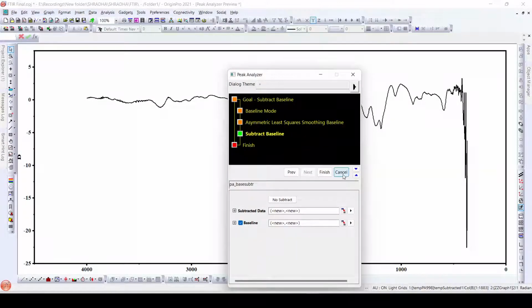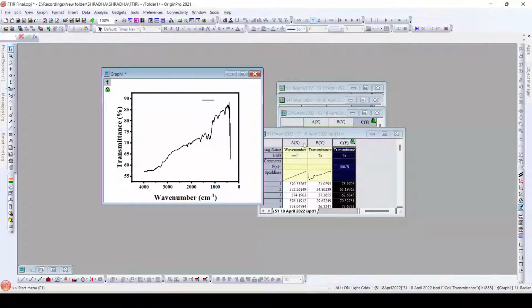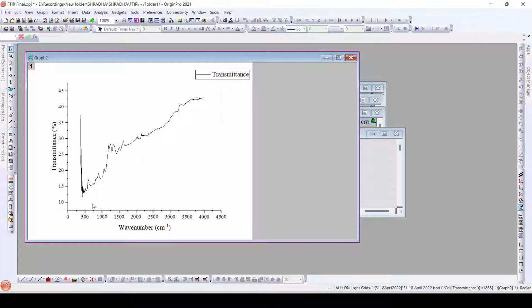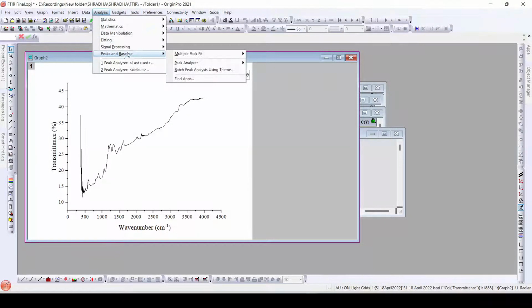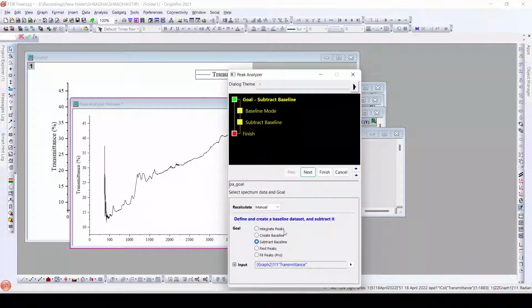So instead of doing this, the initial data that we already had was this, that is the transmittance data, but in the form of absorbance. As we have plotted this, we will first add a baseline to this particular data, and then we will subtract it from 100 so that we can get proper FTIR data. So for this we will go to Analysis, Peaks and Baseline, Peak Analyzer, Open Dialog. Here we will subtract baseline. I will once again recalculate to auto.